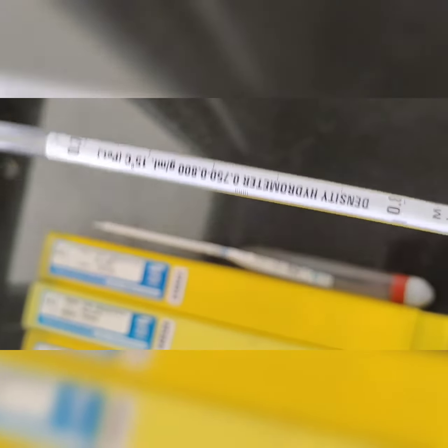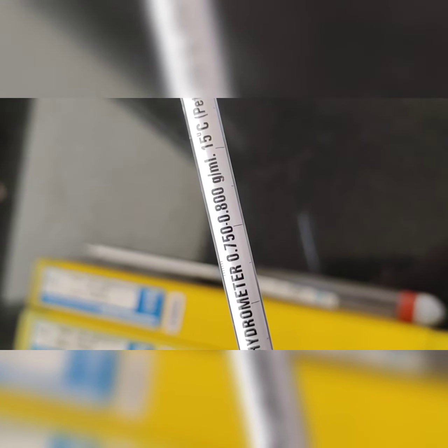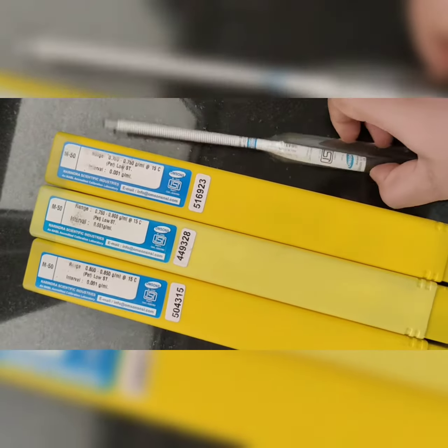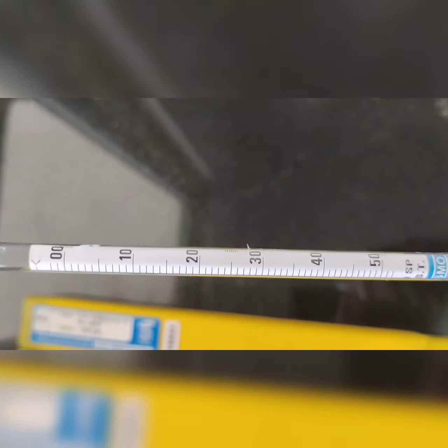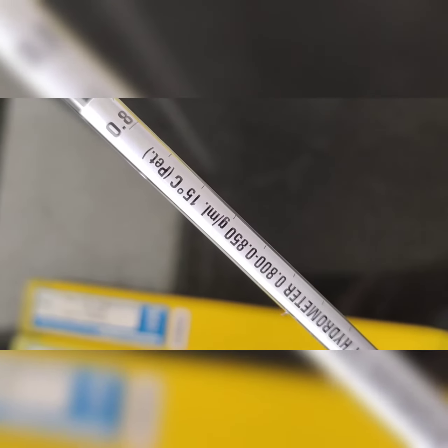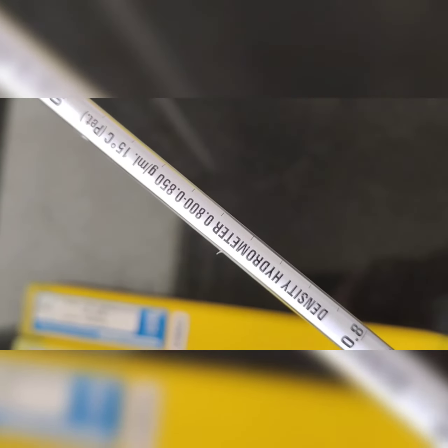So this is the density range. It is written here on this, 750 to 800. Clear? So this is one hydrometer, and the third one, the last one, is 800 to 850. You can see it here, 800 to 850, at 15 degrees, used for petroleum products.